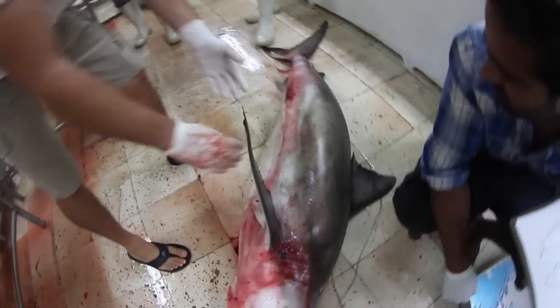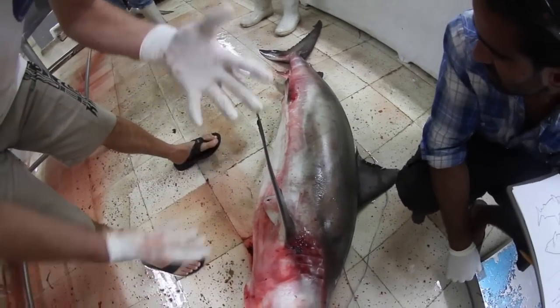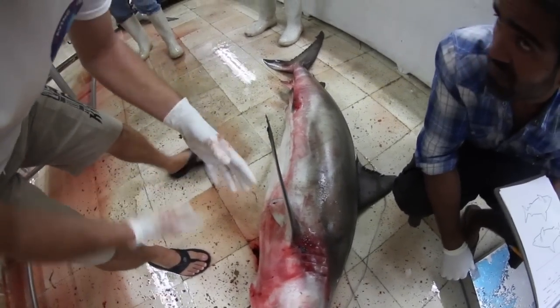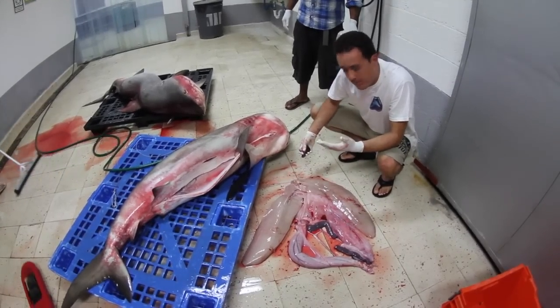The overall tonality is more or less a golden tone or a sandy tone. Why? Because this animal feeds along the coast.